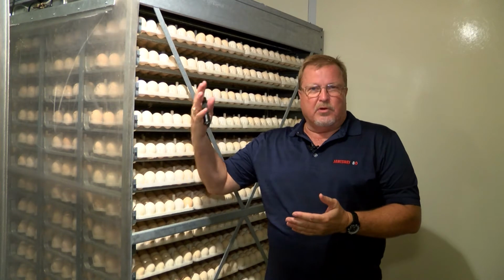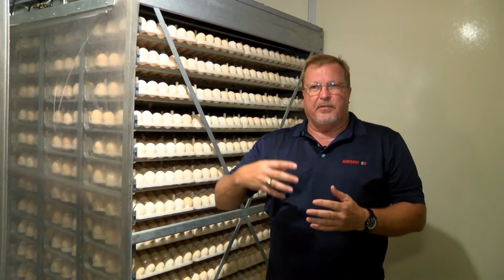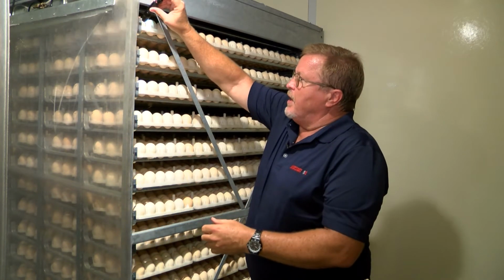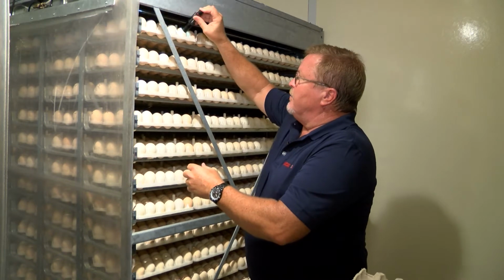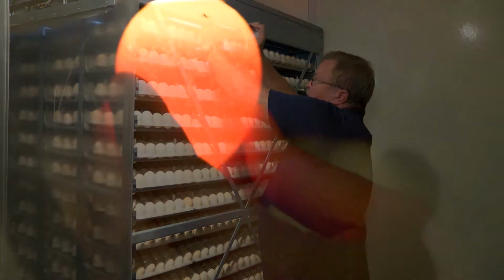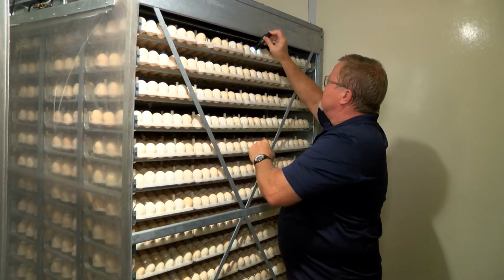So we'll go ahead and candle some eggs, pull the group off here that are unviable, that look clear, and then we'll move forward to break those out at another time. So the way we do this, we'll use a little flashlight, and we'll put the flashlight on the eggs, and we can see the darker eggs containing embryo. When we see a light one like this, we know that is an unviable egg. We collect that, save it, keep going down the row here.